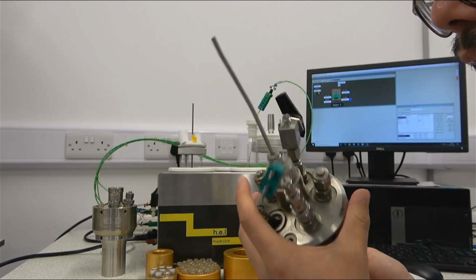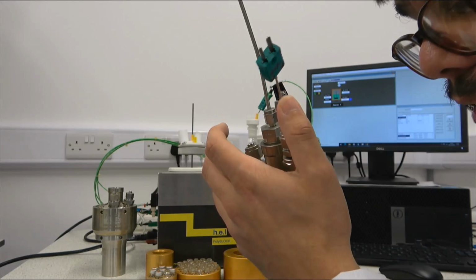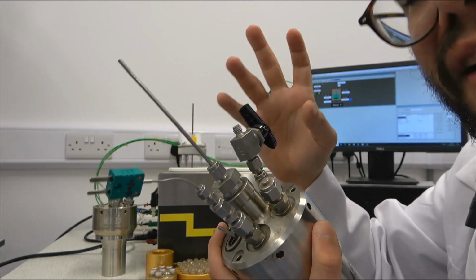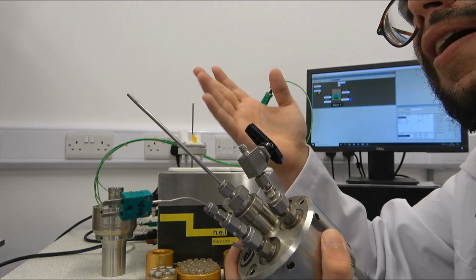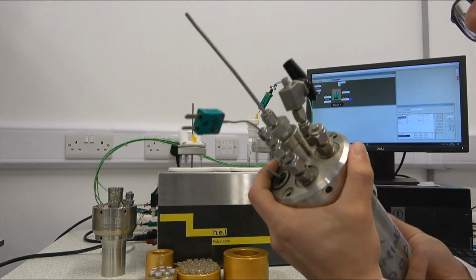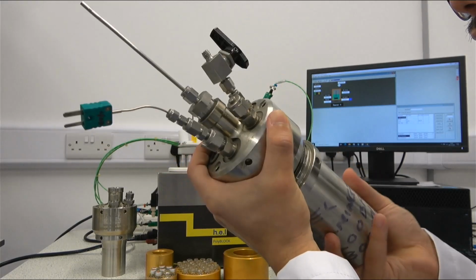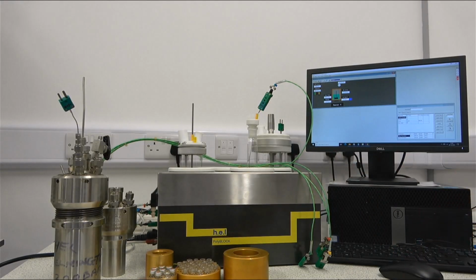So for example, this would be a 300 milliliter reactor that could go up to 200 bar of pressure. And here we have some more examples of things that we can add to the lid. We have, again, a thermocouple to measure temperature, but we can have, for example, samplers. We can have gas samplers, we can have liquid samplers, but we can also add other lines so we can feed or retrieve liquid or gases from the reactor. If we open the reactor, we could see how they look inside. And I think that's basically a big summary of how the hardware itself works.